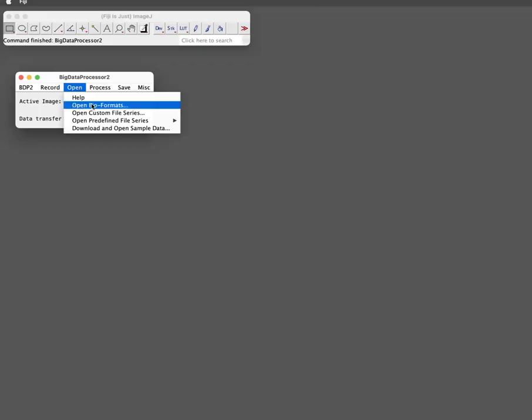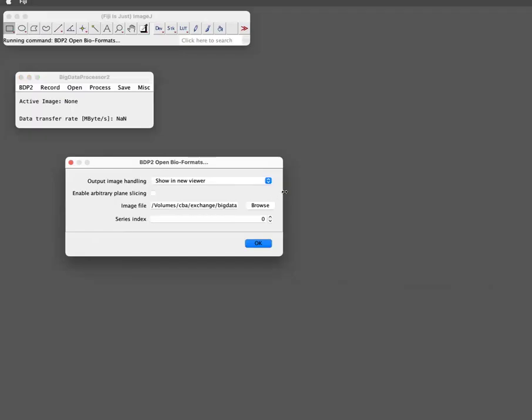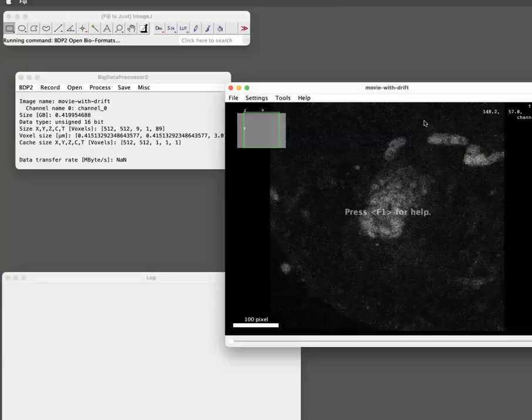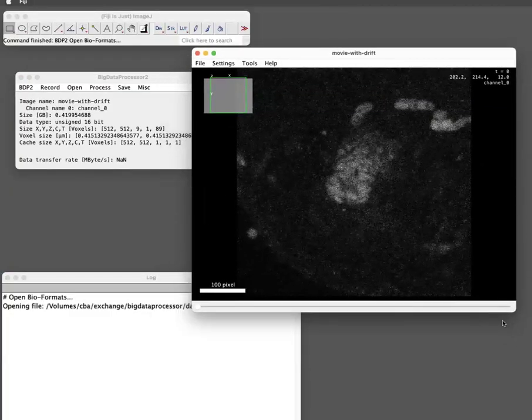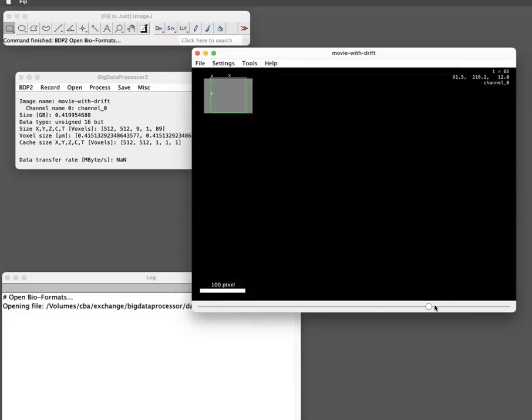So to open the TIFF stack, we are using the bioformats library. And it's already selected here the file path, otherwise you could browse to it. So we just say, okay. Now it's opening the movie. So you can see here some elongated structure, and what we actually want to do is that the tip of the structure is always at the same position. And as you see, if I move here in time, this is definitely not the case in the raw data.